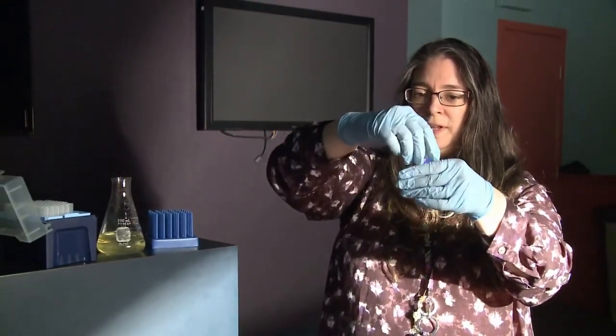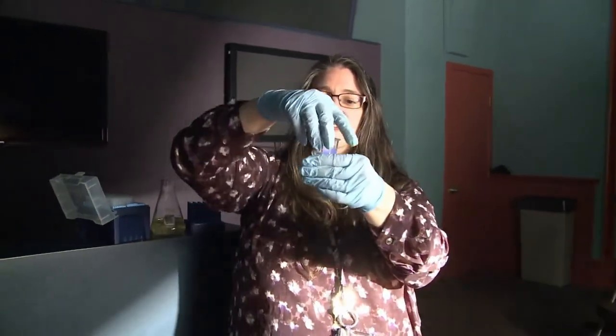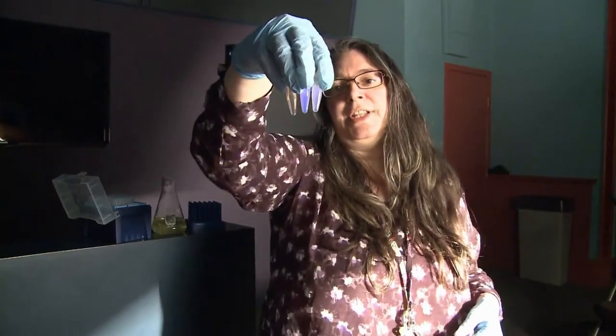The middle one is the one with a little bit more blood, 15 microliters. So let's see how they look. We're going to see how they look with the lights off.